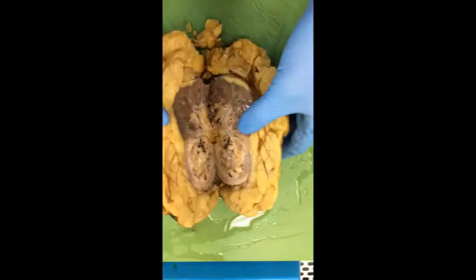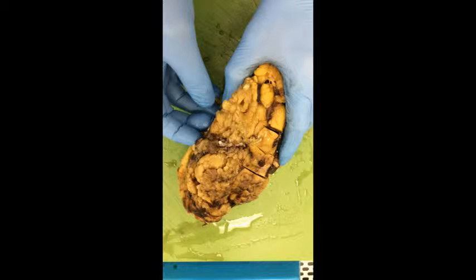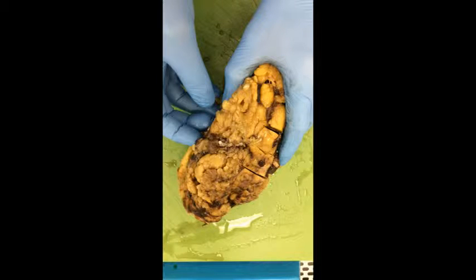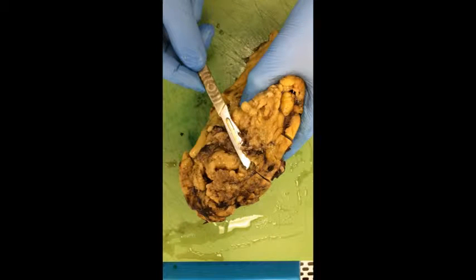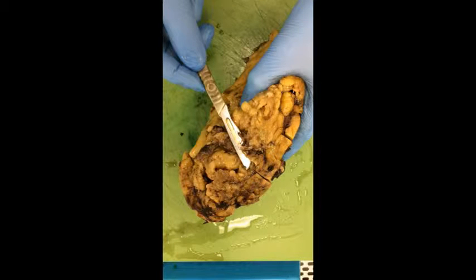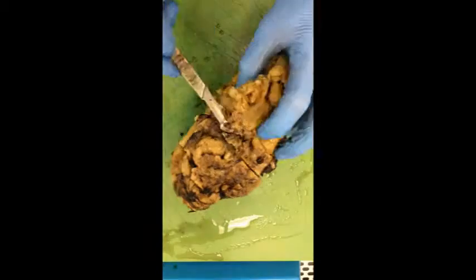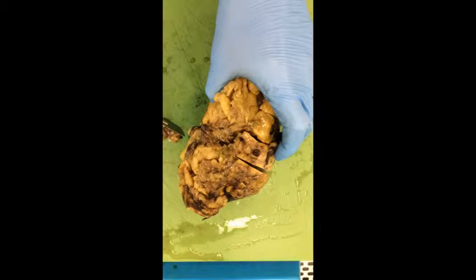After this, examine for the renal hilum and the renal hilum vessels. These can be removed in a scooping action of the scalpel. Place them to one side.